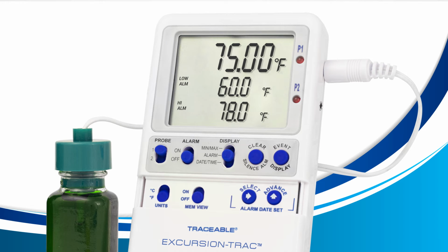View our alarm event history. To view our alarm event history, we're going to use the event display button on the right. Pressing it once will show you the alarm out, and pressing it a second time will show you the alarm in. During this lesson, your device may reset back to the previous screen after 15 seconds of inactivity. Simply press the event display button again until you return to the screen you need to view.